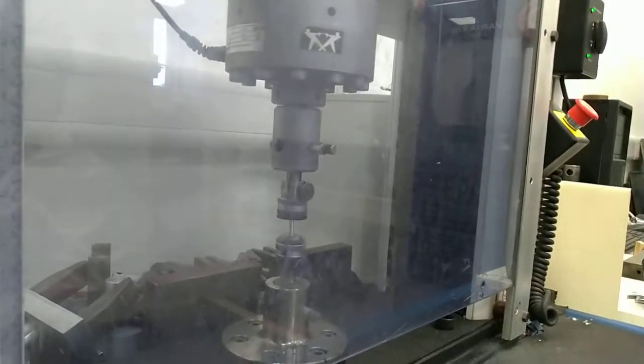very clearly the necking stage. And we can remember that from the PLA sample, the maximum value for the load will be 1.1. Try to see. Okay, it's broken, so we can stop the test.